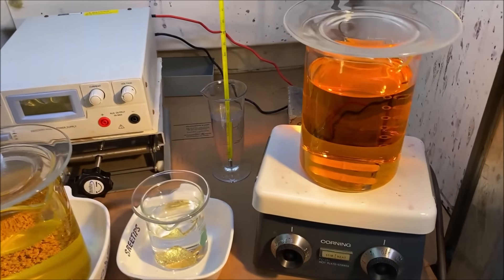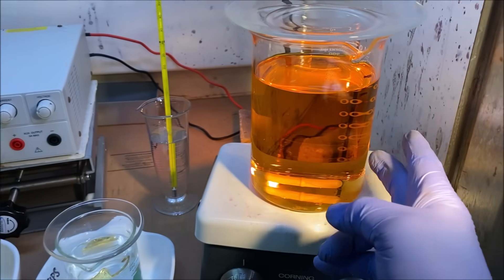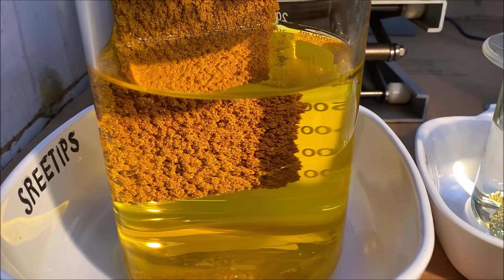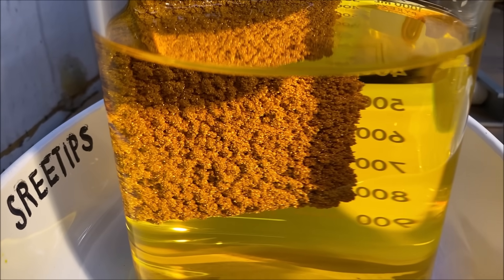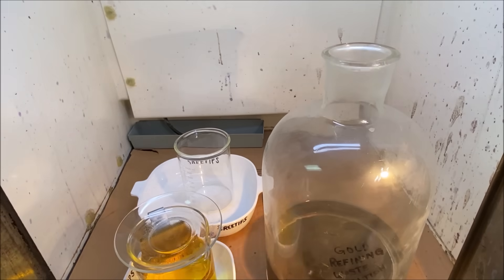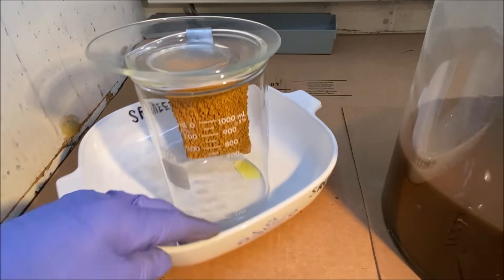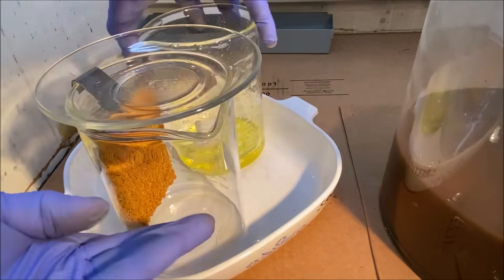The electrolyte here will have lots of gold in it, and there's some crumbs of gold down on the bottom of the beaker. What I'll do is get this out of the way and we'll process it later to make some high purity gold powder from this electrolyte. Then we're going to get down in here and see if we can get some of that gold crystal off of the cathode — that's beautiful, see it sparkling. The yellow rinse water will have lots of gold in it, so I'm going to add it to one of my temporary waste containers and recover the gold later. This will probably take quite a lot of rinsing because the gold crystal is going to be impregnated with that electrolyte.